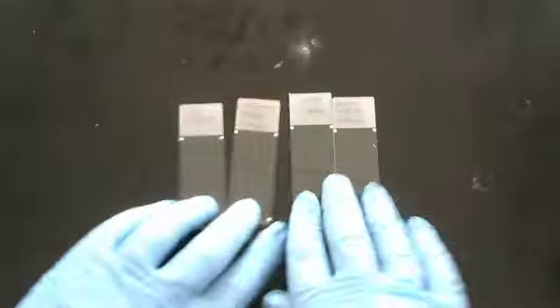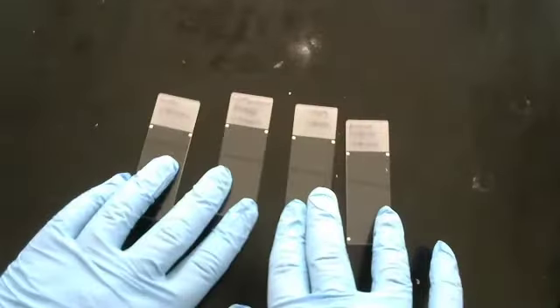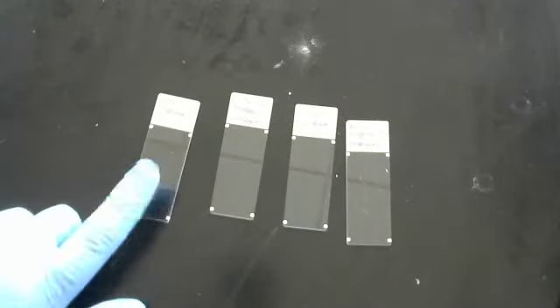Our next test is going to be the catalase test, and for this one we have our slides out. This one here is E. coli, so we're going to start with some E. coli.